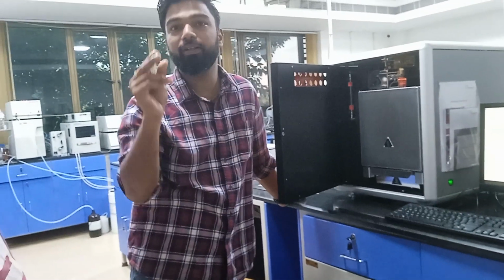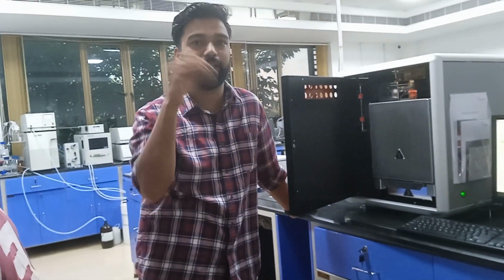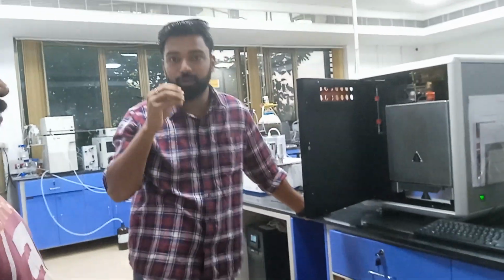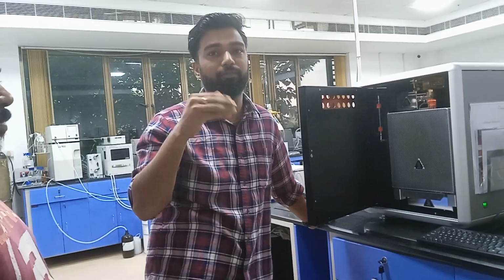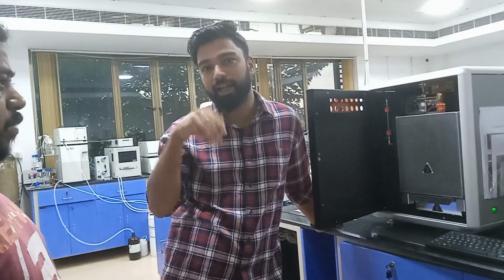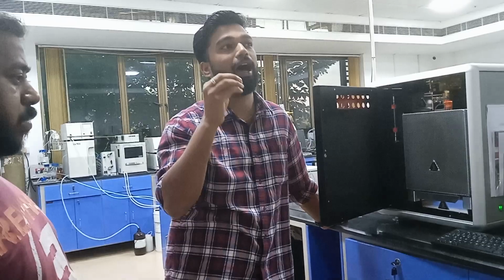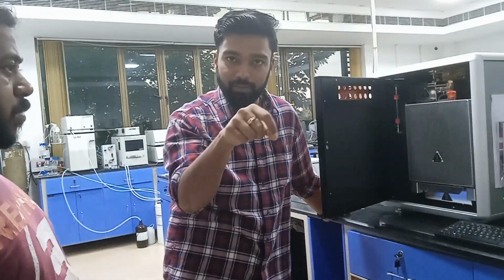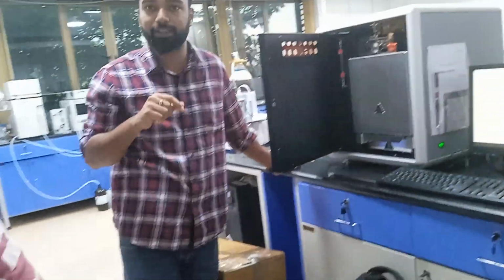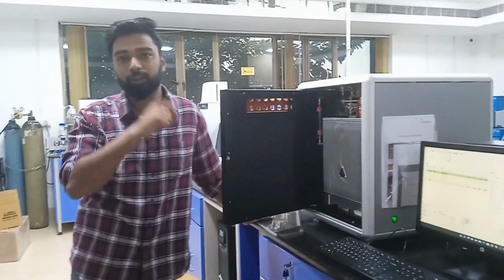For soil samples, carbon identification is the tricky part. You have to increase your sample size to get your exact carbon percentage, so we increase the weight of your sample. For a standard, ideally, whether you put 1 mg or 2 mg, it should give the same percentage result. But in a soil sample, you have to find the right spot.